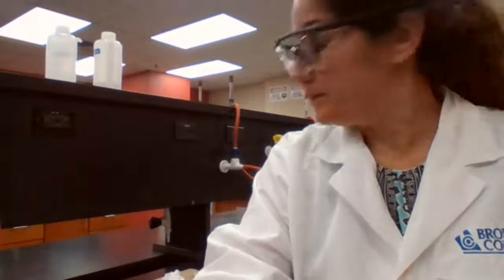Temperature of copper, which is assumed to be same as boiling water.